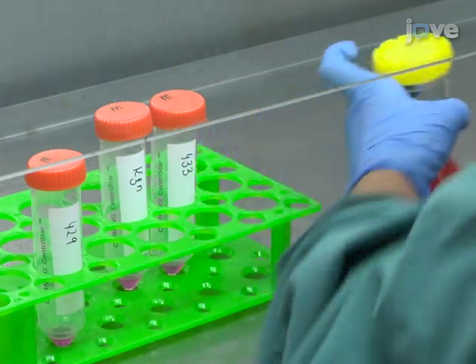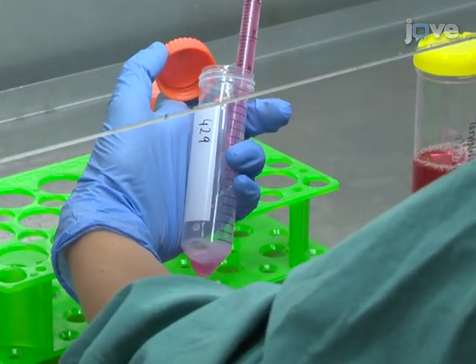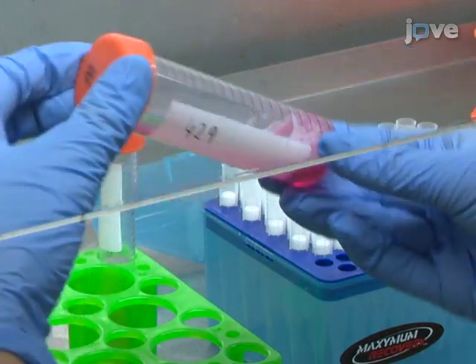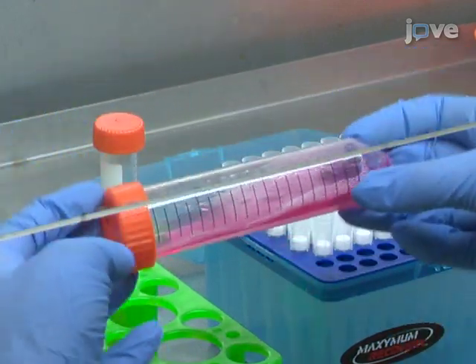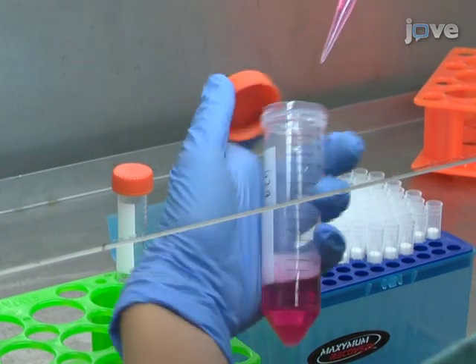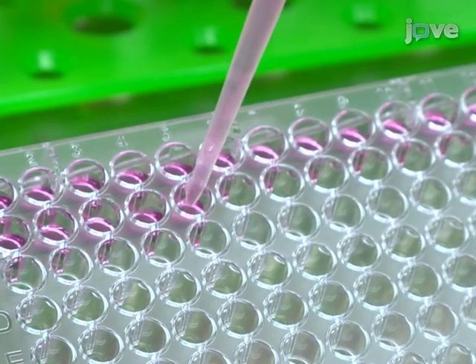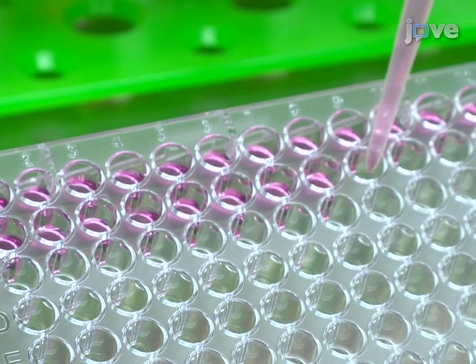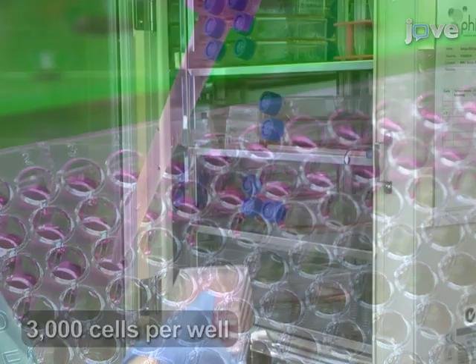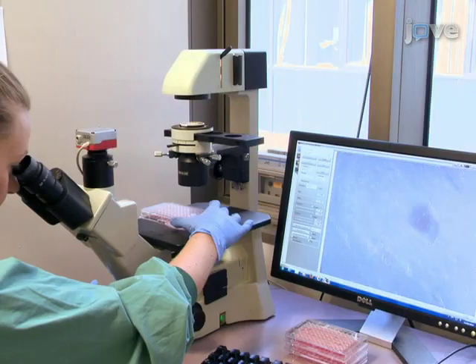Begin spheroid generation by measuring out the volume of culture medium appropriate for each cell line, which is 15 milliliters minus the volume of cells needed. Add 3 milliliters of methyl cellulose stock solution to the culture medium to achieve a final methyl cellulose concentration of 20% and mix thoroughly by gentle inversion. Add 300,000 cells to the methyl cellulose-containing medium, mix thoroughly, then pipette 150 microliters of the cell-methyl cellulose media mix into each well of a 96-well concave bottom culture plate, resulting in 3,000 cells per well. Culture at 37°C, 5% CO₂ for one to four days or until uniform spheroids form.